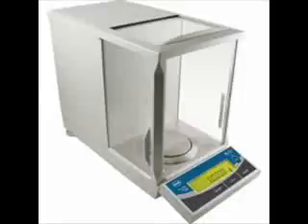One of the first things to realize when using a balance is that it is a highly sensitive piece of equipment. To minimize uncertainties when using a balance, you should observe the following guidelines. The same balance should be used when taking a series of measurements. There are small differences between balance units which can cause errors. You should not lean on the table supporting the balance while taking measurements. This can cause vibrations or other forces to affect the balance's measurements.